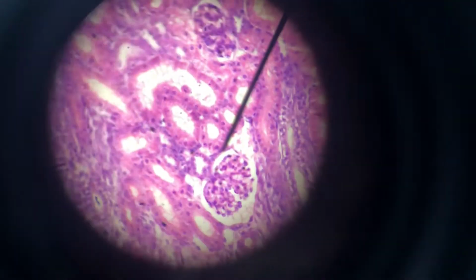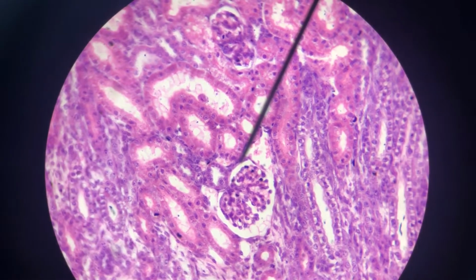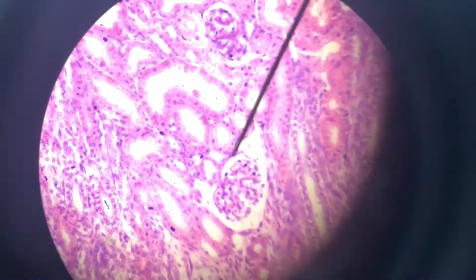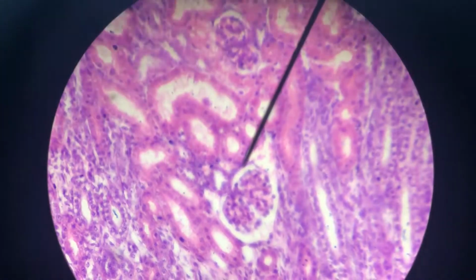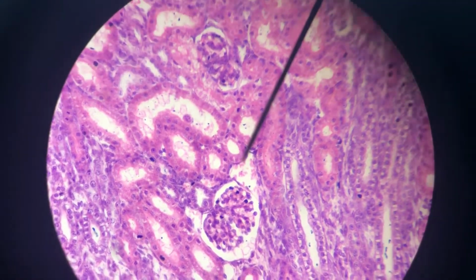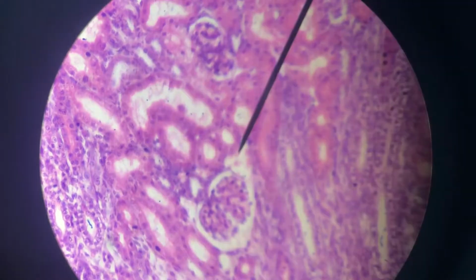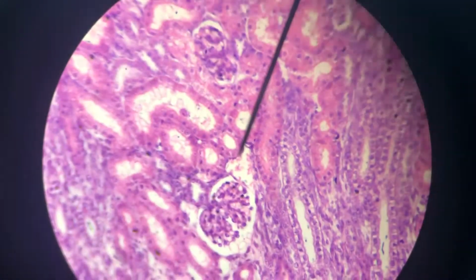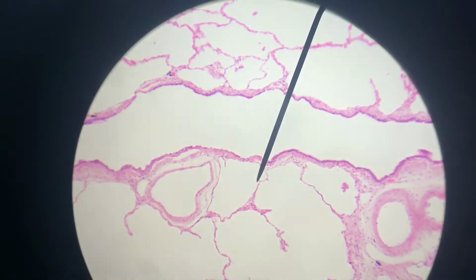I'm trying to focus it. And all around it, do you see right at the tip of the pointer how that's just one thin cell layer, and there's a white space there. On the outside of that white space is one cell layer thick of squamous cells. And then all around it is the simple cuboidal tissue of the renal tubule. So here's the basement membrane right there. And then the lumen is the white open space you see. So the apical surface, or the free surface, is opposite the pointer. And so that's simple cuboidal, and that's simple squamous.